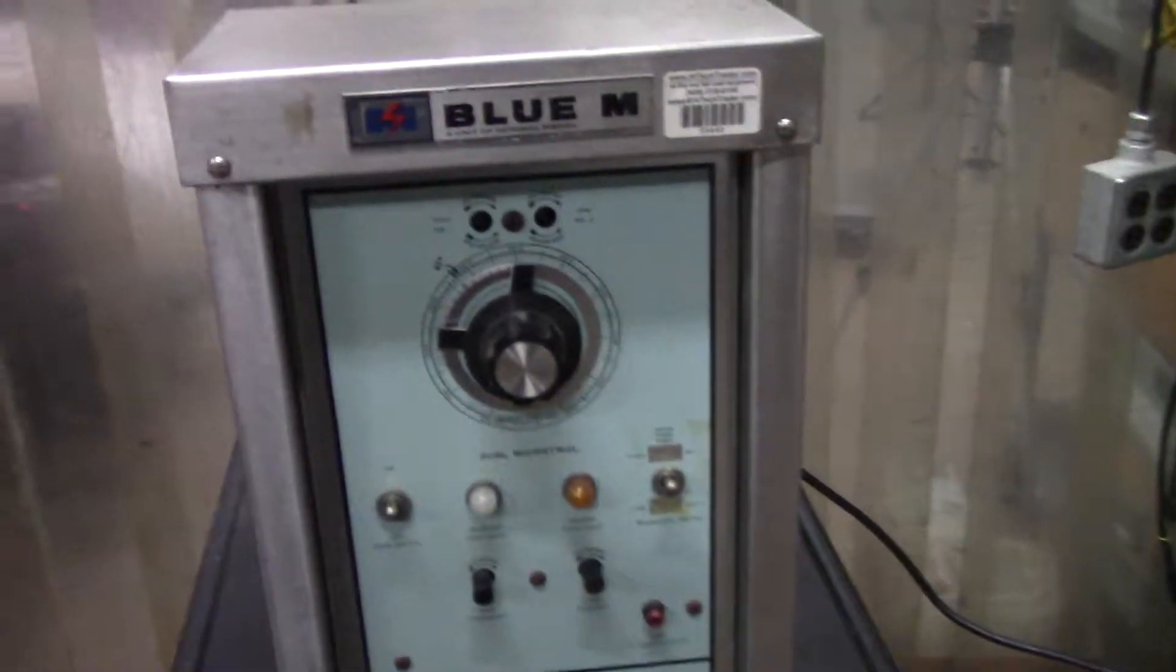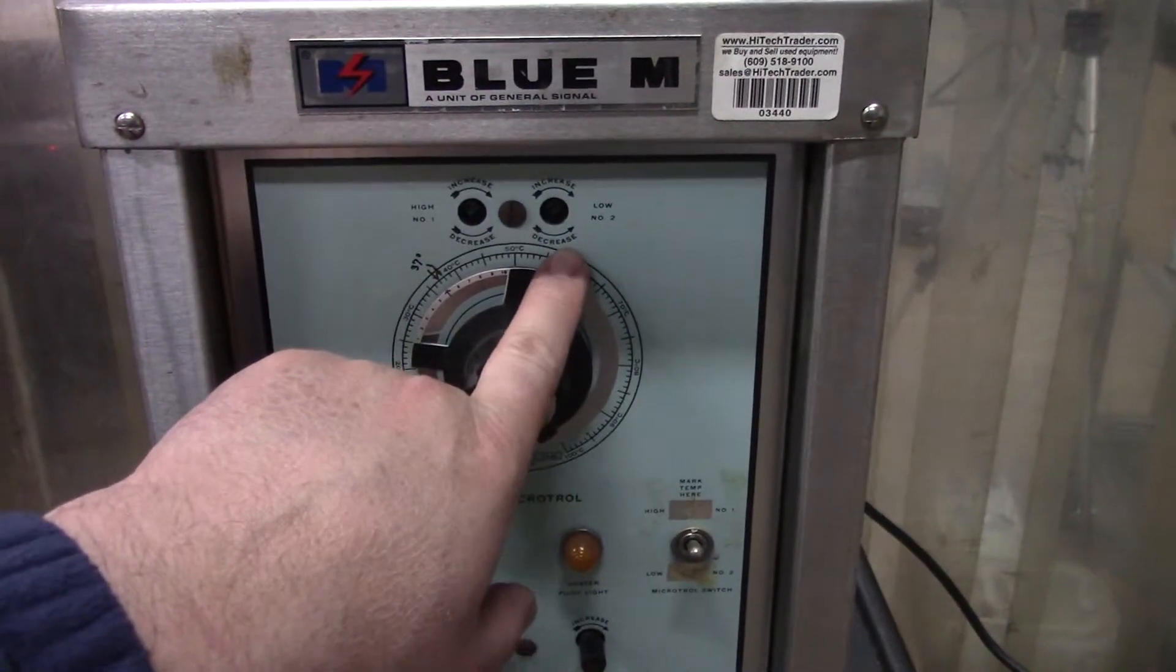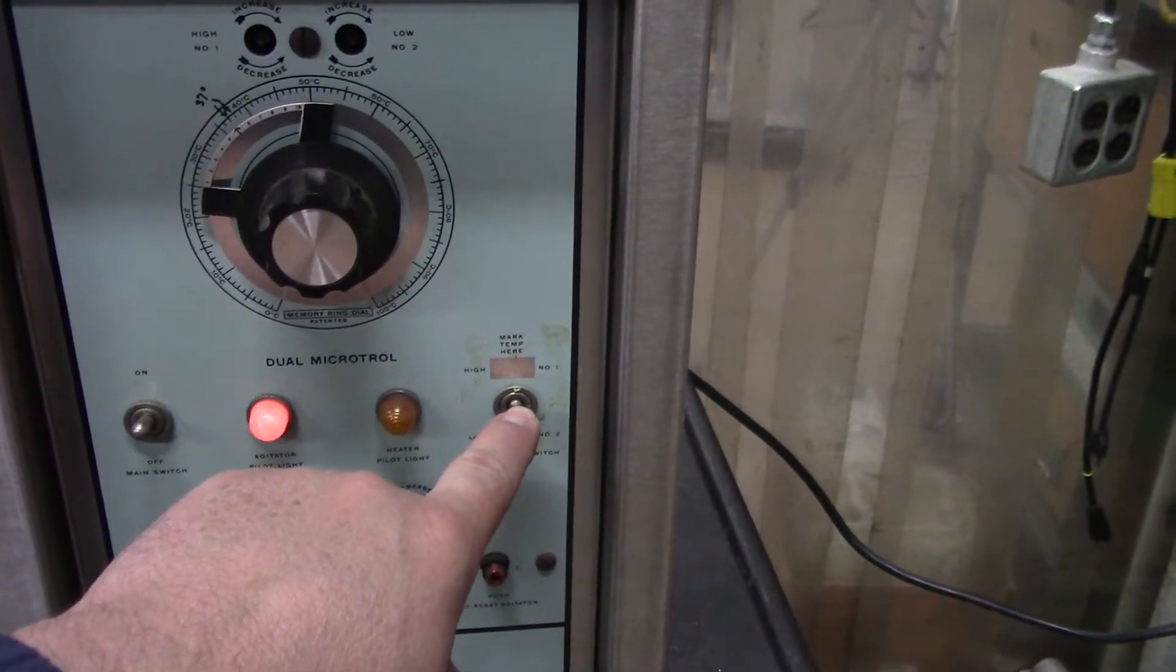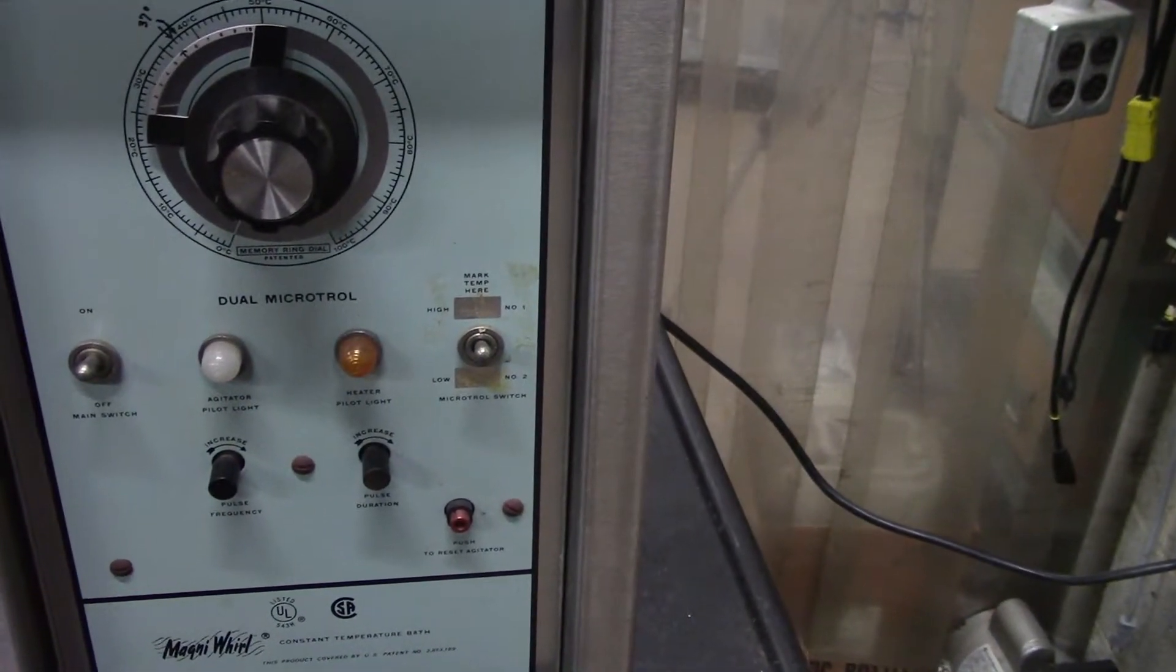This particular instrument allows you to increase or decrease your low or high temp settings. You can have it set to those set points by this indicator switch.